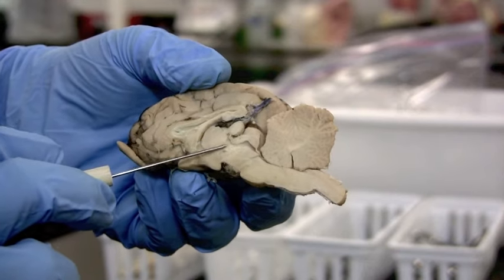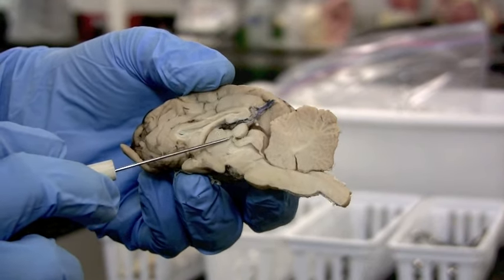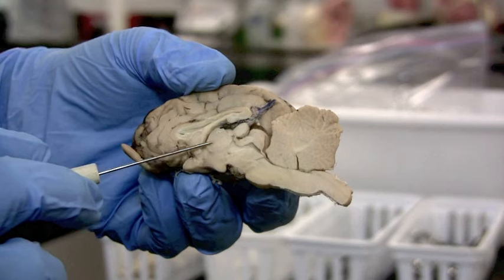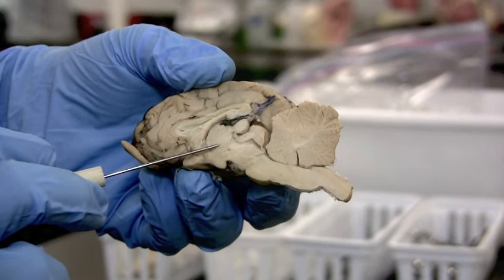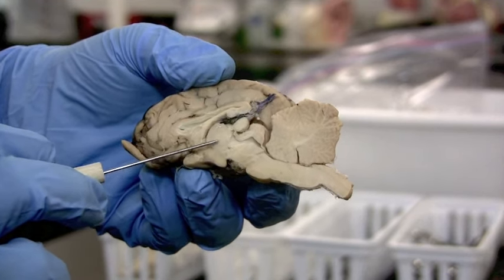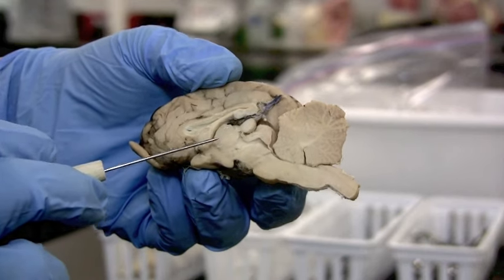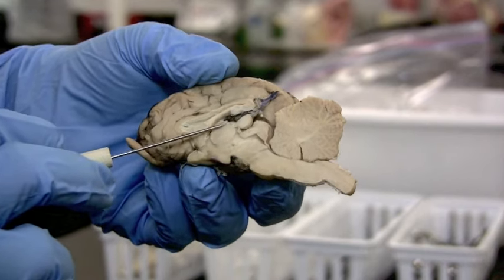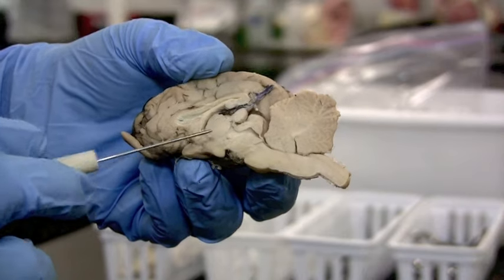It's a very good landmark when you're looking at a sheep brain that doesn't have a lot of differences in the tissue — it just looks like a big blob of tan tissue. So if you have the circle, that's the thalamus.